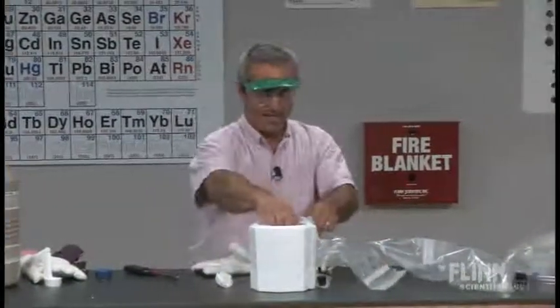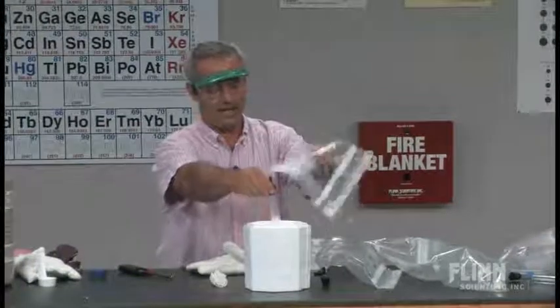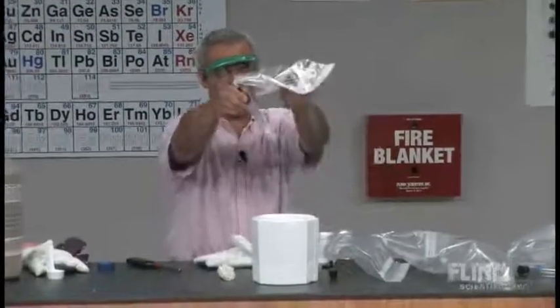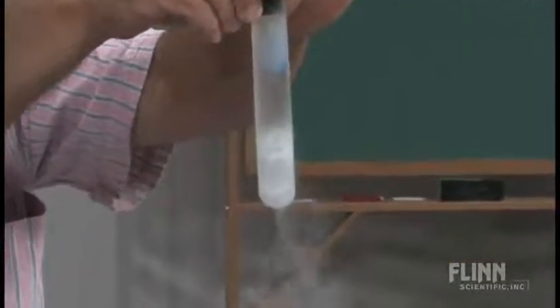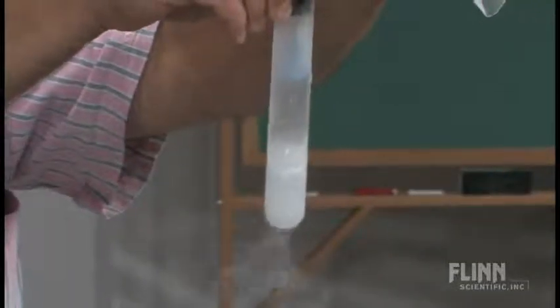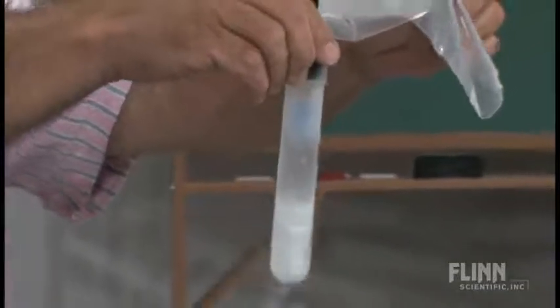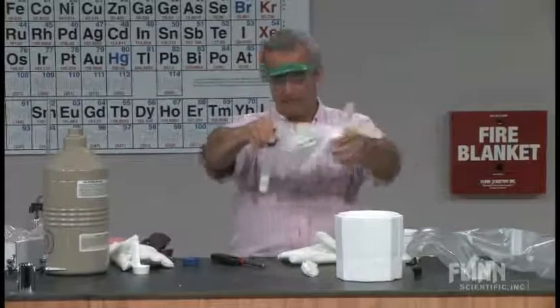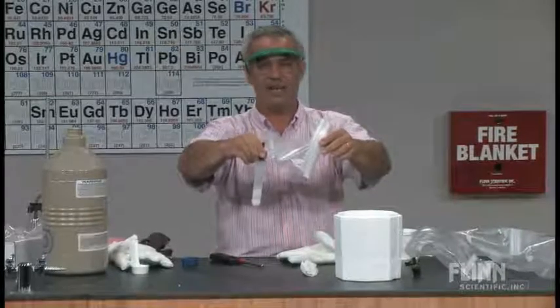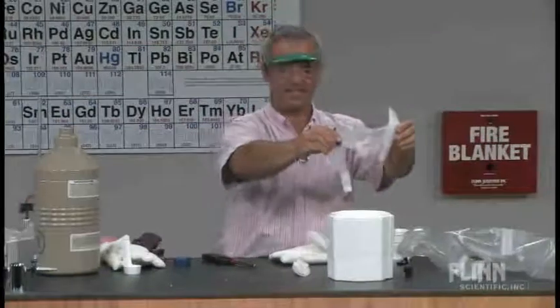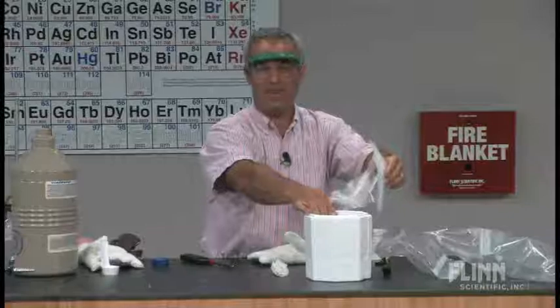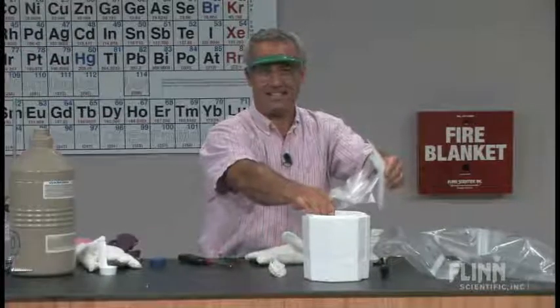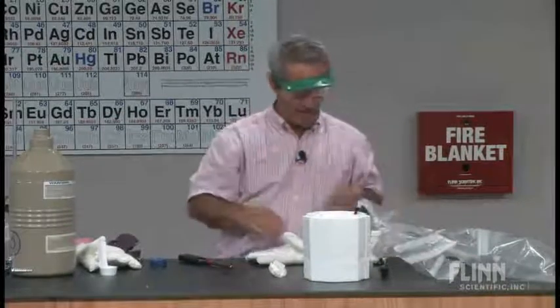What about my methane? Last one. This we expect to have actually solidified. And we've got kind of a milky, some solid up here on the sides, but otherwise it's kind of a milky. It's in the process of freezing. We just leave it in there for about half an hour to get a solid plug of it. And I've done that once and I dumped it out on the table like I did with the carbon dioxide. And it looks like wax, which makes sense. I mean, after all, it is a hydrocarbon. It's the baby of the wax family. It makes sense that in a solid form it should look like wax.